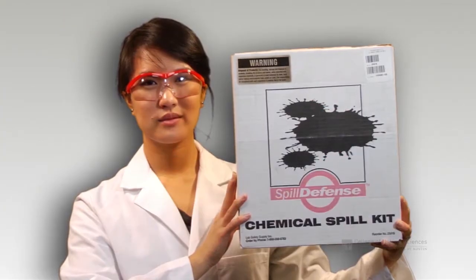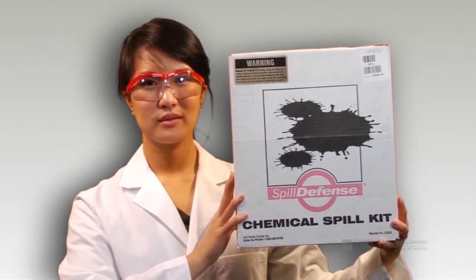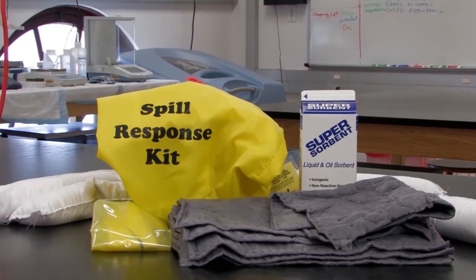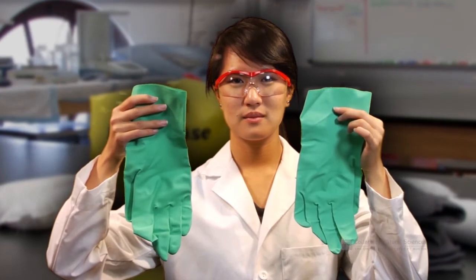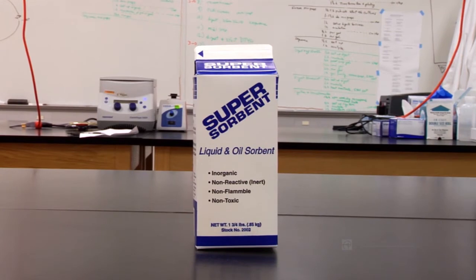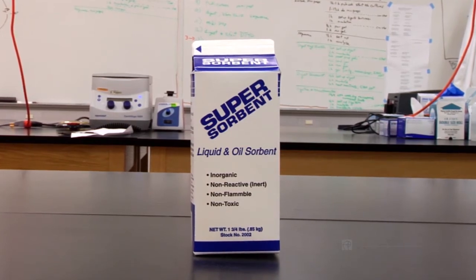In addition to knowing the SDS information, always be aware of the location of the chemical spill kit located in the laboratory. The contents of the spill kit will vary between different laboratories, but should include a universal spill absorbent, chemical-resistant PPE, and hazardous waste disposal bags. An acid spill neutralizer or a base spill neutralizer may be added to the kit if you are working with acids and bases.